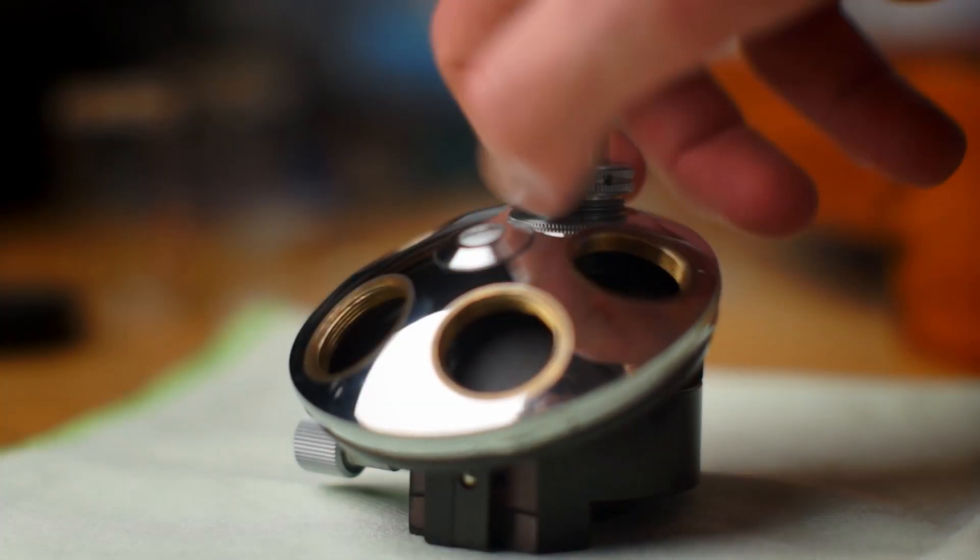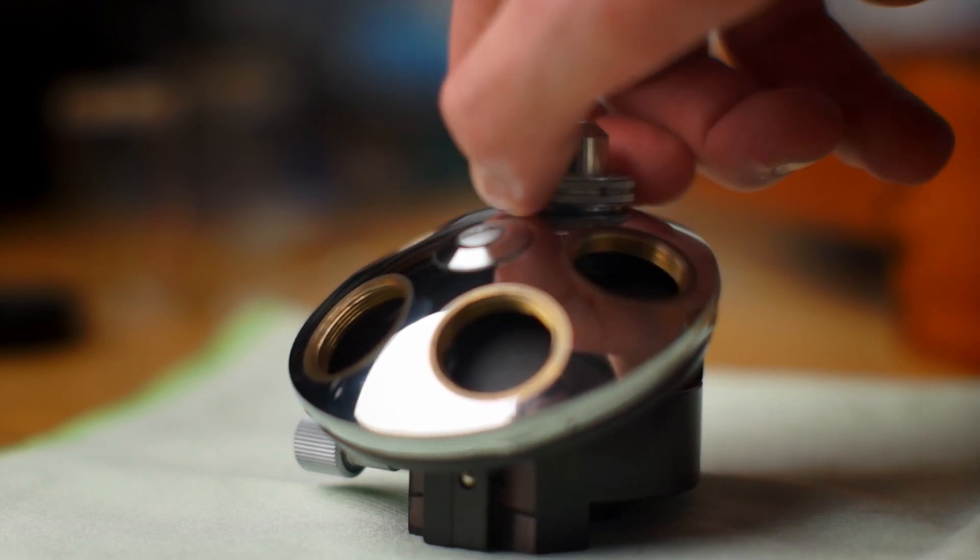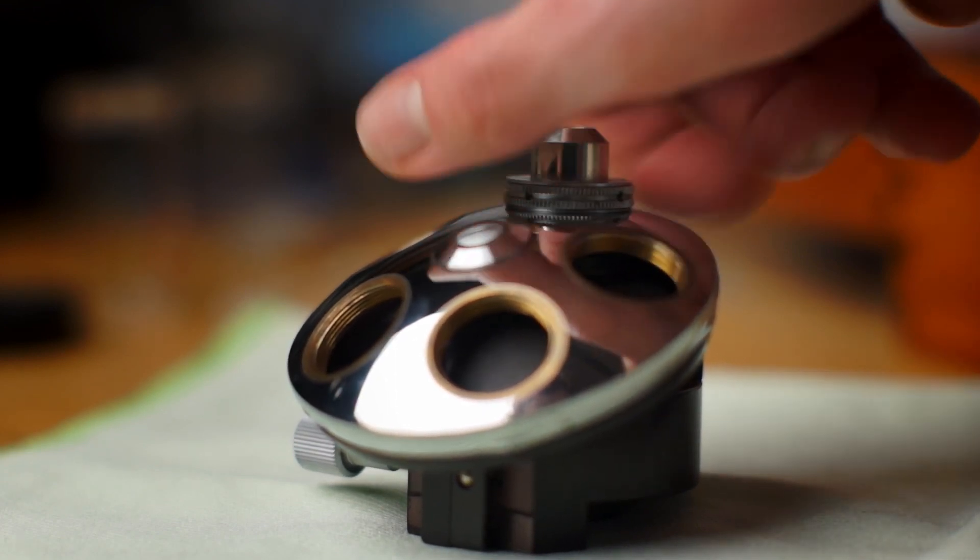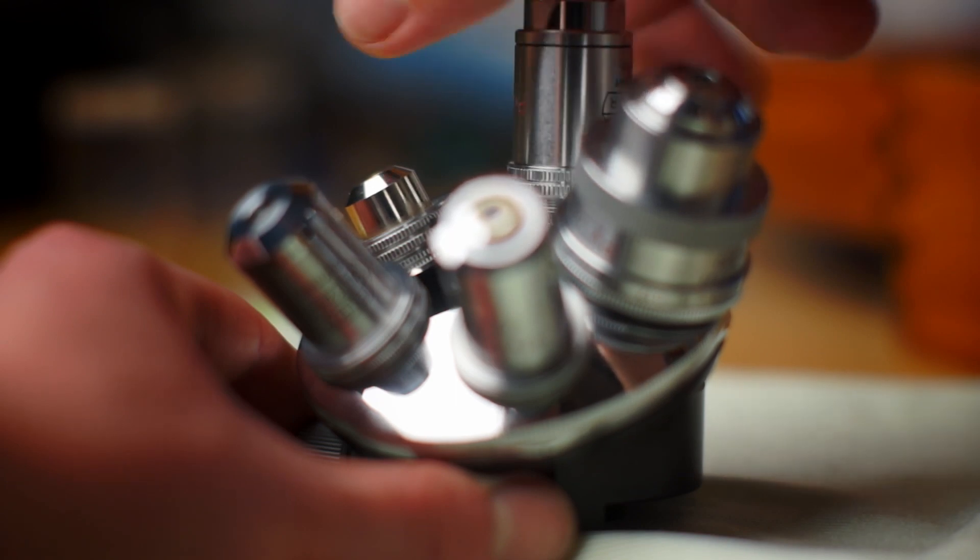The only thing left to do now is to replace the objective lenses we removed earlier. Make sure to replace them in ascending order of magnification.